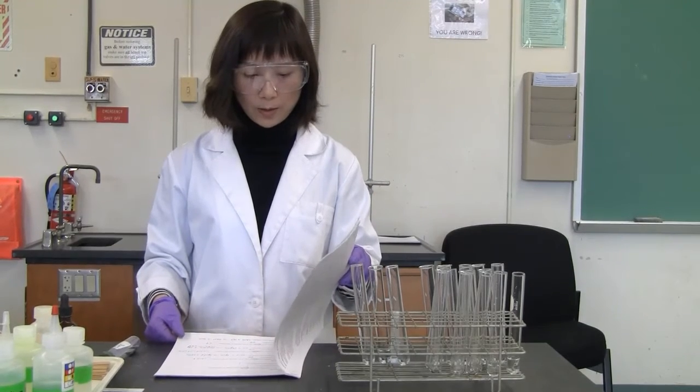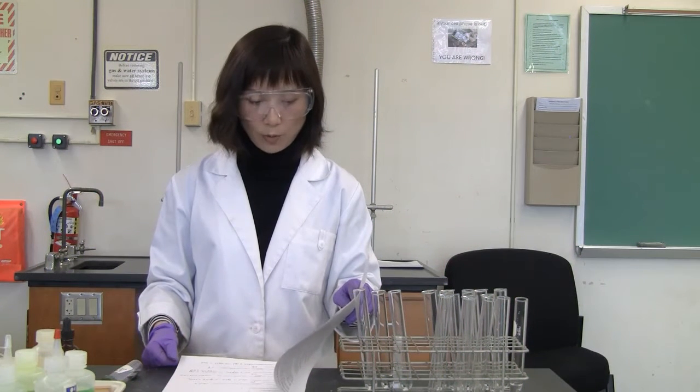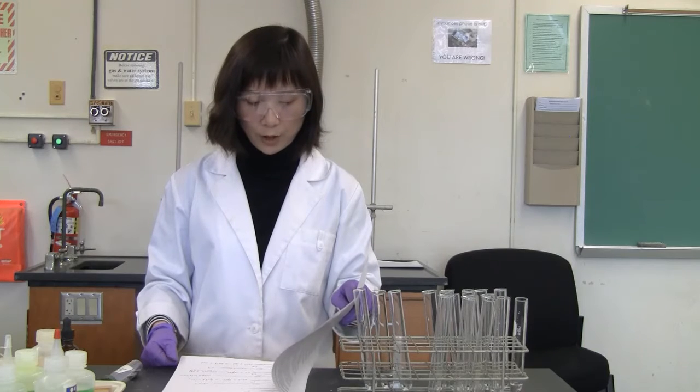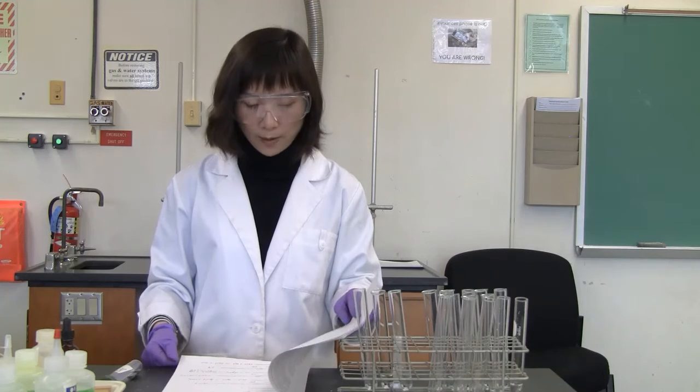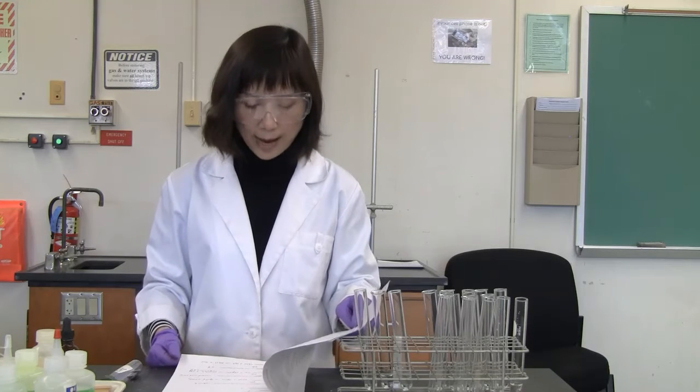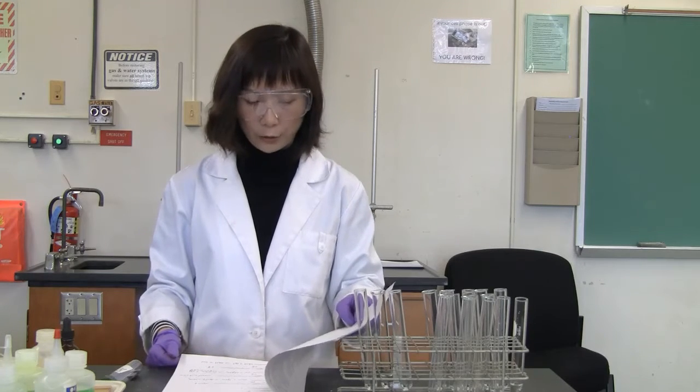Okay, now here is Chemistry 111 type of reactions 2 lab. So again, in the data sheet, you needed to write down for each reaction the observation of the reaction. And of course, based on the observation, you can decide if a reaction is happening or not. So you will see yes or no. You're going to circle one.